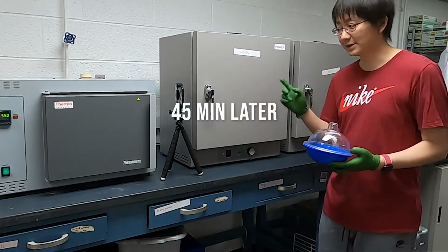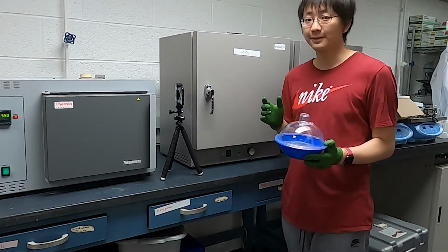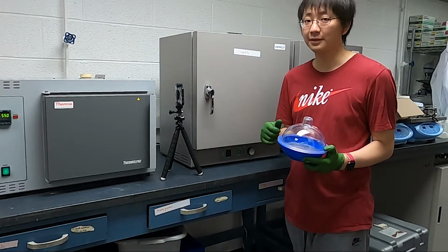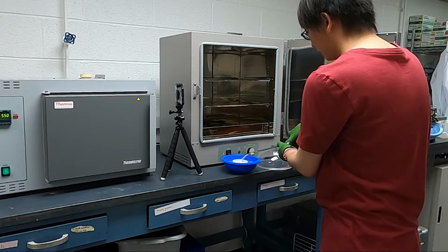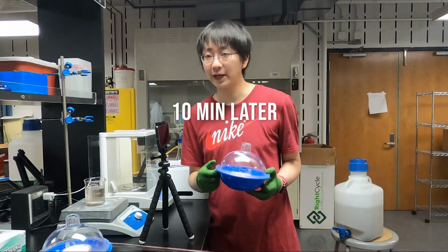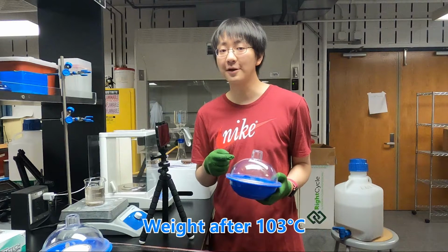But before we take the sample out, we need to prepare the desiccator to make sure there is no water vapor getting into our samples or our dishes. And so when we get the sample, we need to make sure it is cooled down for about 10 minutes.